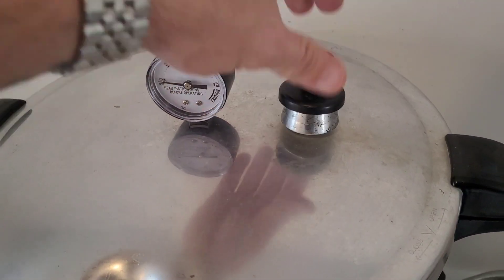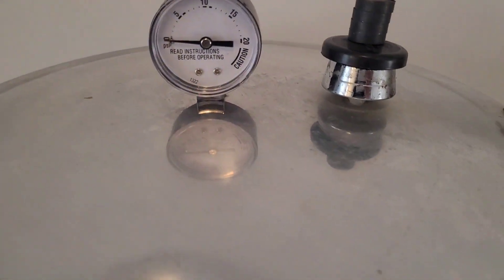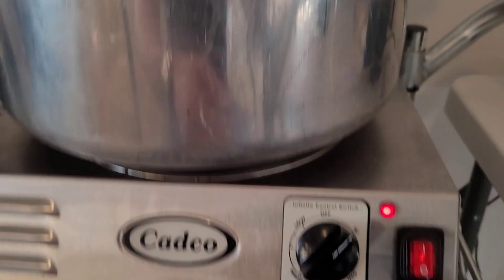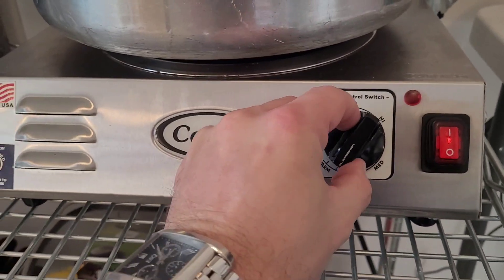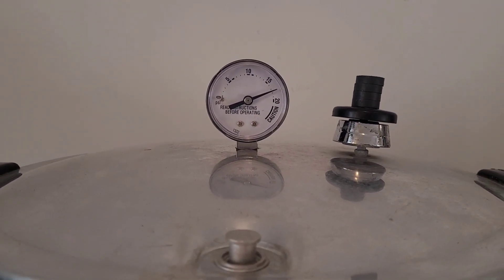Both valves have just popped and you can hear the steam and trapped gas evacuating — it's now time to start your 15-minute timer. By venting off all internal trapped gases and replacing them with steam, you allow the internal temperature to reach a true 121 degrees Celsius when it hits 15 psi. Once the timer is up, add your weighted jiggle weight and allow pressure to climb. I usually allow the dial to climb to 17 before cutting the heat, and I'll be running this cycle for 90 minutes.